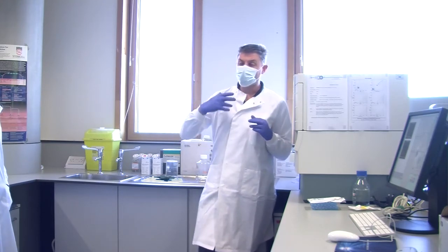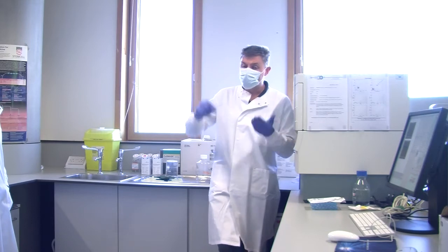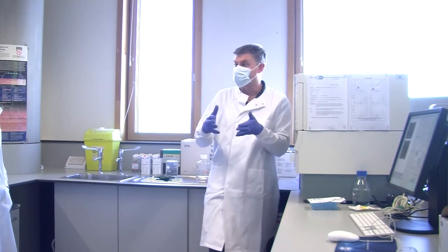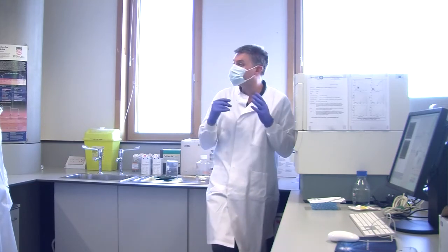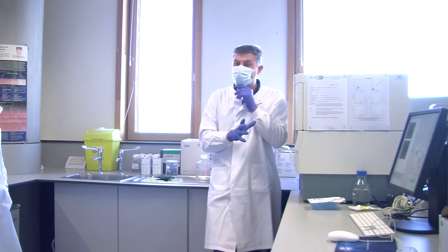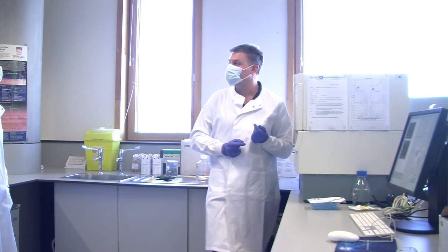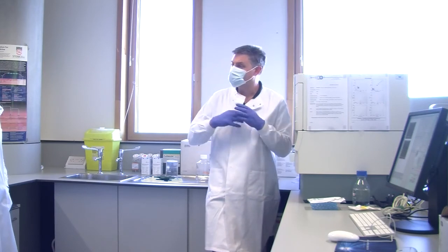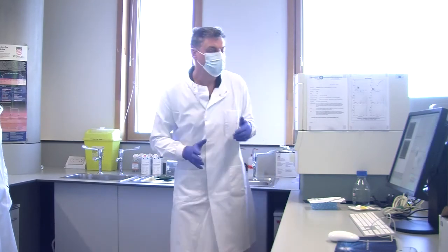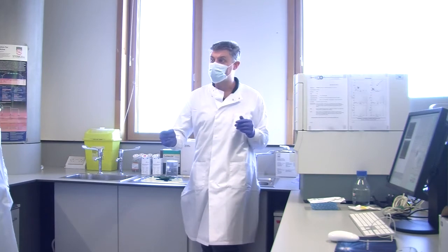But this is where the automation that I mentioned earlier, the superfast plate reader, starts to fall down. Because it reads by going into that well, and that well, and that well, and you get carryover. It might only be 2%, and it's fine for a screening system, but you wouldn't want 2% carryover in a research project. Because if you're looking at T cells, and then B cells, and when you run your B cells, 2% of them are T cells, that's not good. You can't tell anything. So what we often do is wash the probe, and run a tube of water between samples, because carryover is a problem.